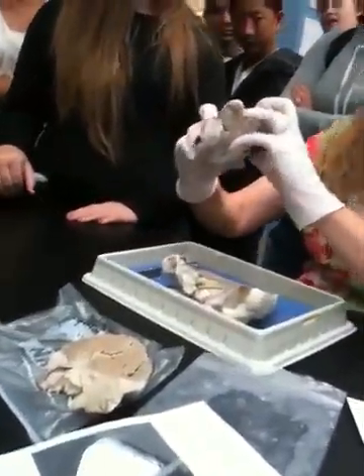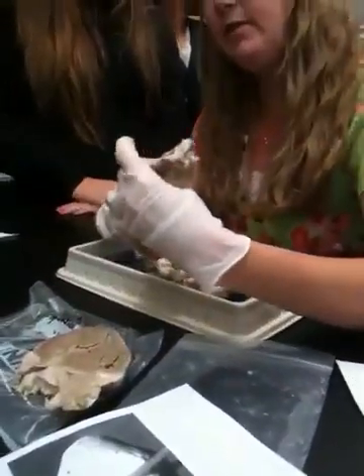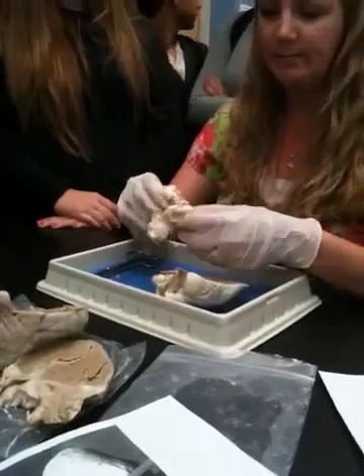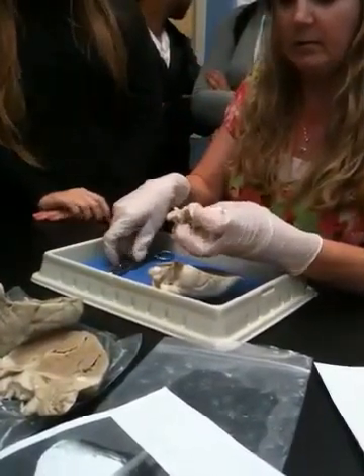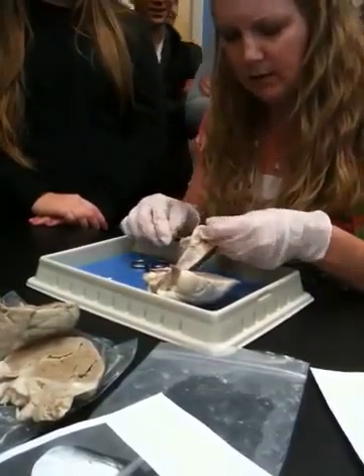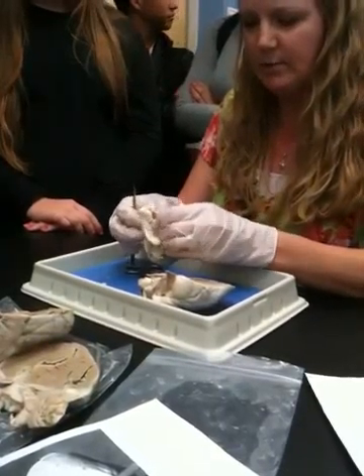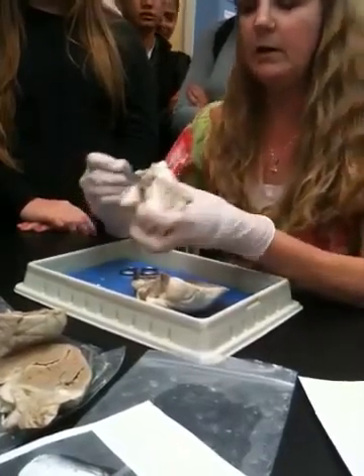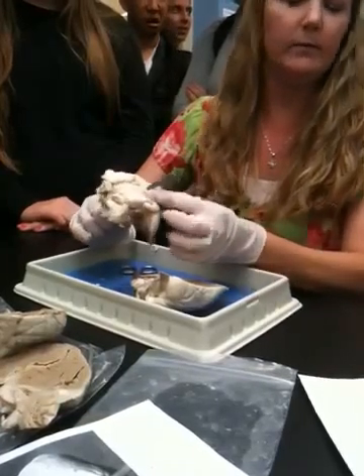Okay, so anyhow, those were the ones that we could see. Some of the things that you guys did not see, which are visible on this one, were the superior and inferior. I think on this one you can see it, maybe. Oh, maybe not. Never mind, this is cut up too much. So here's the inferior vena cava right here.